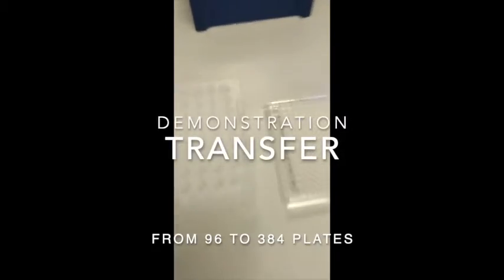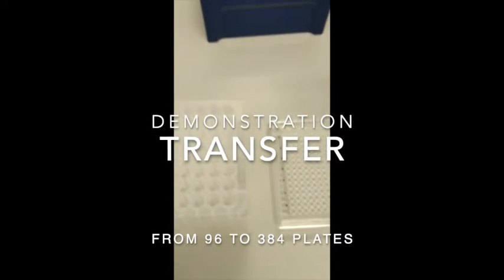Here is a quick demonstration on how to transfer from a 96 plate to a 384 plate. Imagine this to be your first elution plate, and with your 12-channel pipette, go into the A row and pipette here, so that, as you can see here, A1 is always one well skipped.